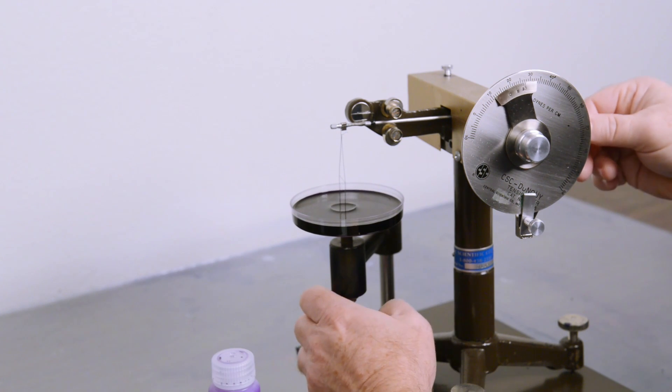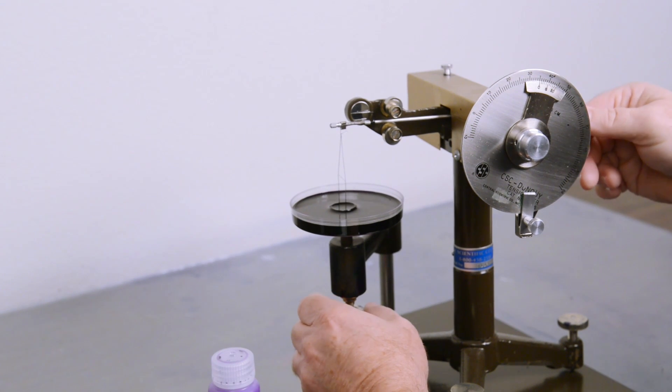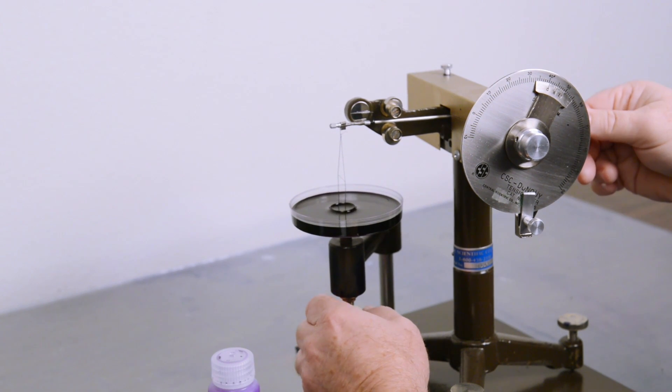Start turning our dial, lowering, more tension. Starting to pull.